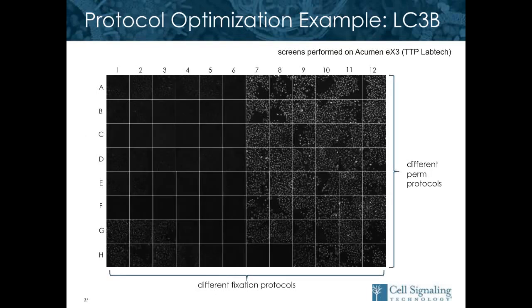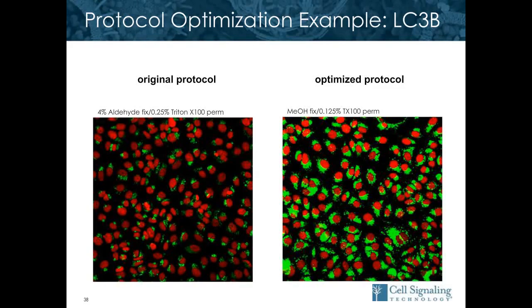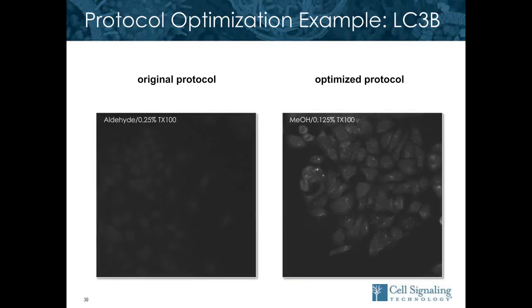As I switch to the image from our high-content imagers, you should see right away a difference in signal from the left to the right. But maybe that's non-specific stain. So we dig in and look at all the images, and in the end chose one that really improved the signal to noise. Our standard protocol is on the left, 4% formaldehyde with 0.25% Triton, and on the right is the optimized protocol. And you can see the dramatic increase in signal. Here's the actual IF image, so you can't even see the autophagosomes with the protocol on the left, but they're clearly visible on the right.